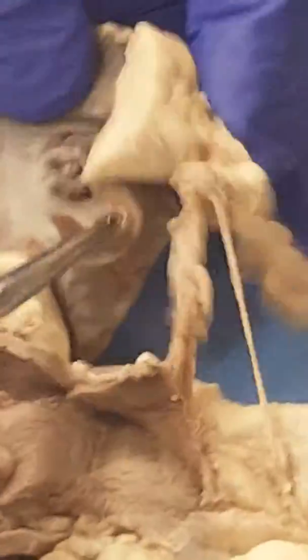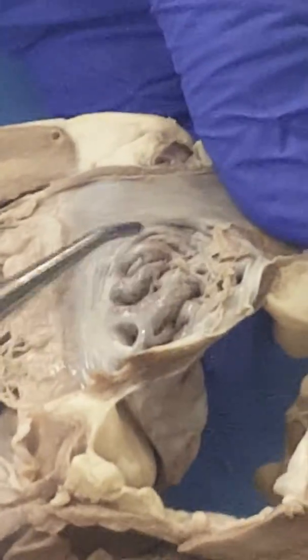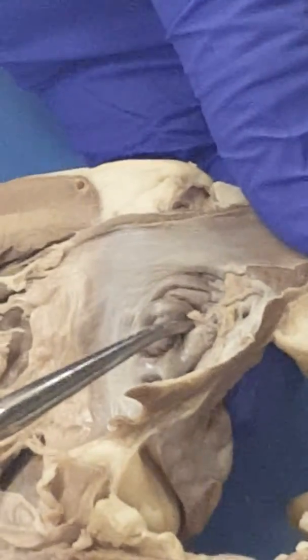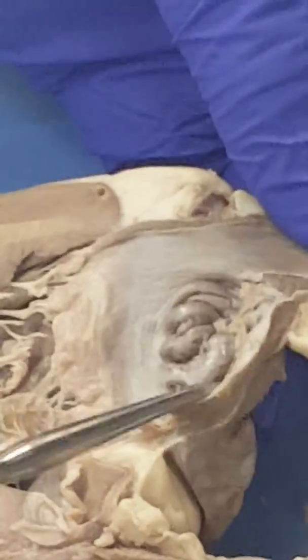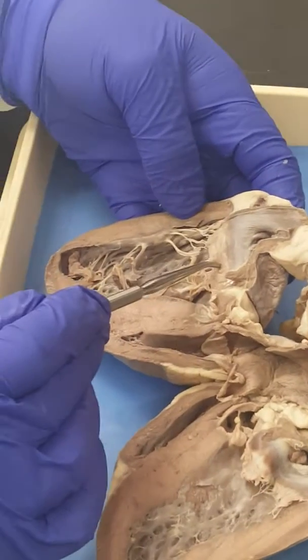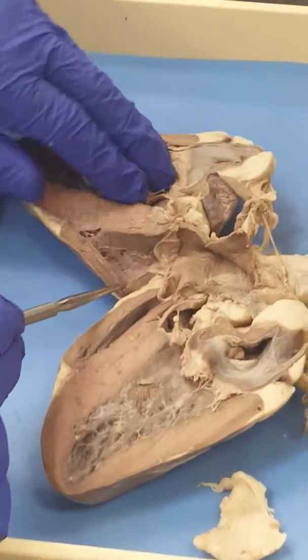Then also in the atria, there are these small grooves. You see these small ridges, the smaller ones? So if I put a pin here and I'm asking what are those small ridges, you say musculi pectinati, okay? Or you can say pectinate muscles, okay? So the smaller ridges, this is the auricle, remember? The auricle, which is this. And so that's the left auricle, okay? And then there will be the musculi pectinati, and then of course the bicuspid mitral valve, okay?